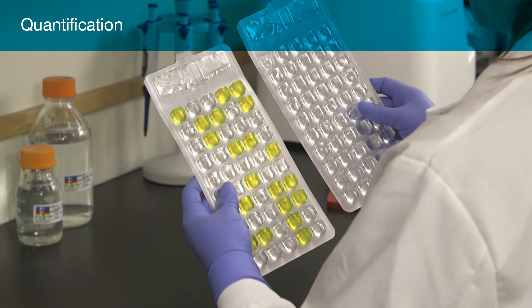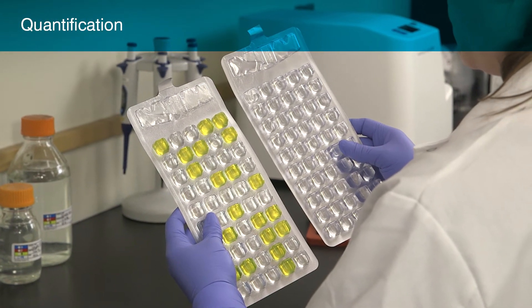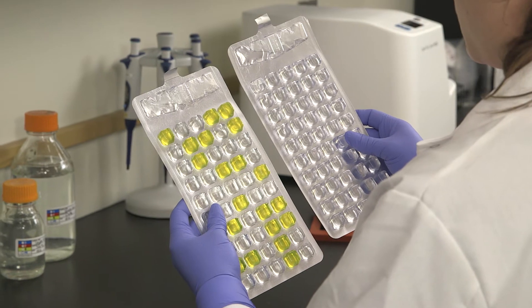Next, you will learn how to use the ColiLert test with the Quantitray system to determine the number of coliforms and E. coli in a water sample.